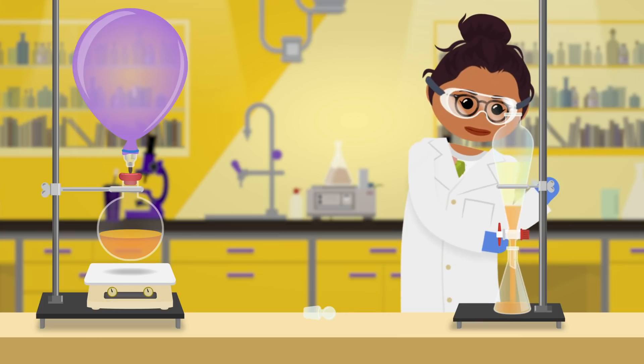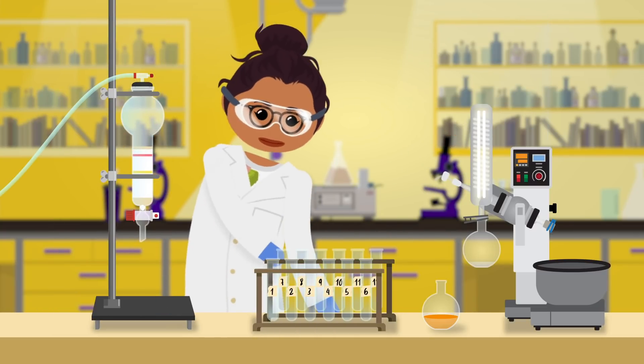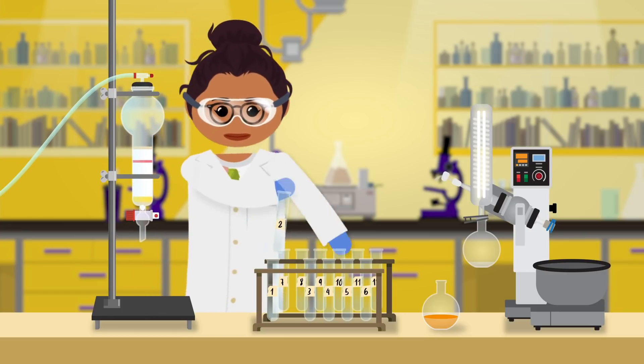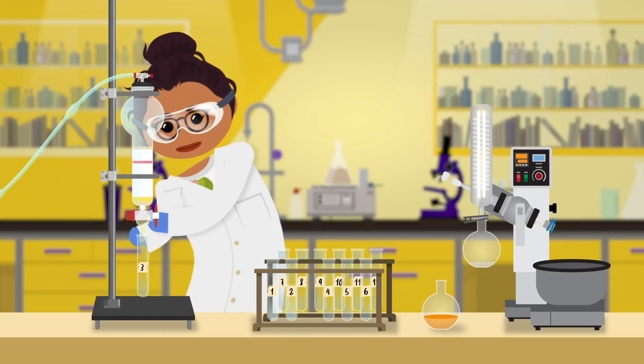Now it's purification time! Organic chemistry involves a lot of flash chromatography, sometimes running several columns in one day. This type of purification lets us separate compounds based on polarity, but we can also use other chemical properties to purify organic compounds. So let's learn about some different lab techniques and practice some synthesis problems along the way.